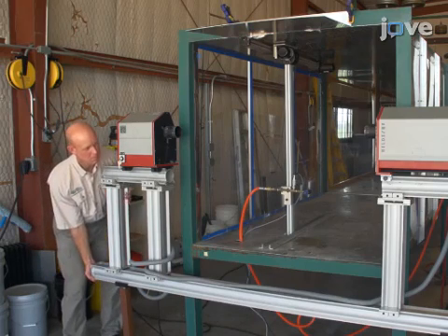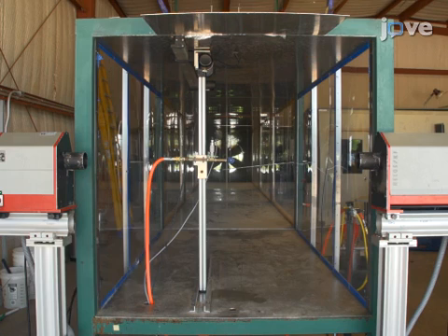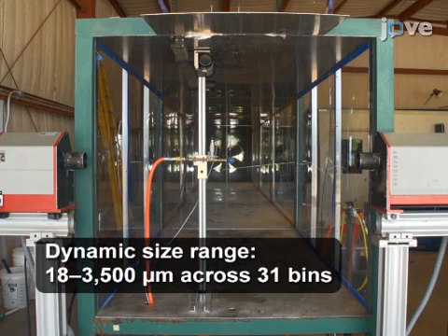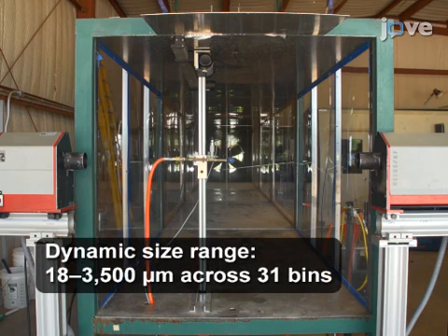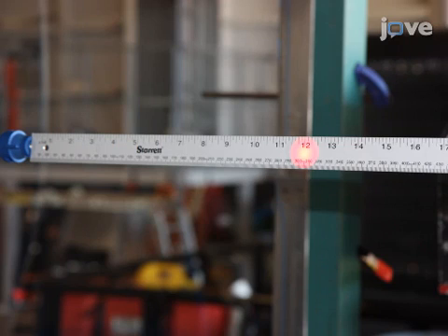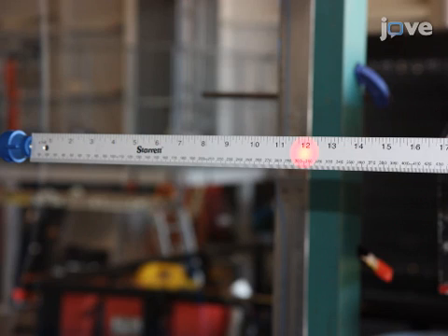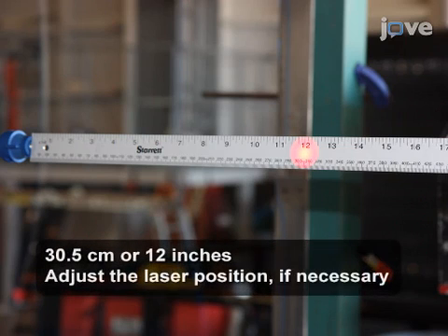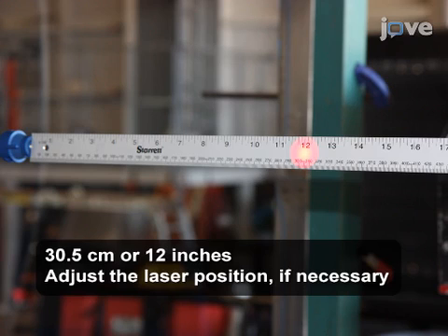Measurements take place just outside of the wind tunnel. Properly align and configure the laser diffraction system in front of the wind tunnel and nozzle. Before proceeding, measure the distance from the nozzle outlet to the system's measurement zone. The distance should be 30.5 centimeters.